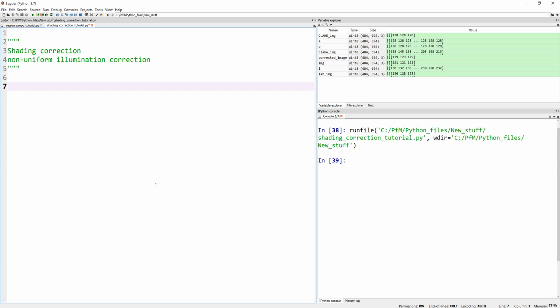My recommendation is to set it to at least the size of the largest object that you have in your image, the largest feature. So now, before any further ado, let's go ahead and call the required libraries.